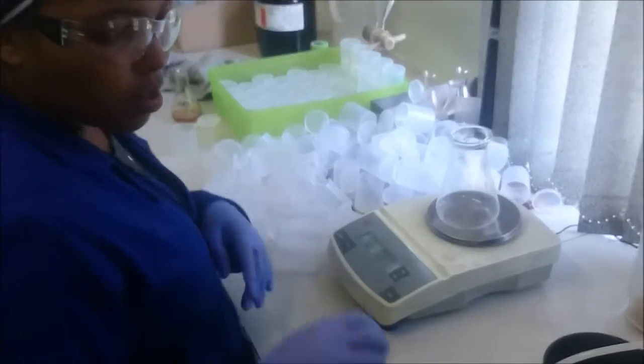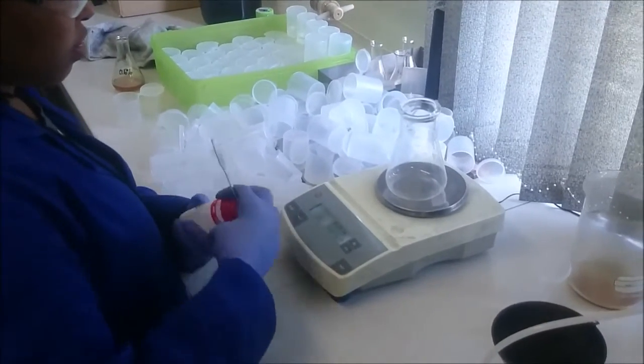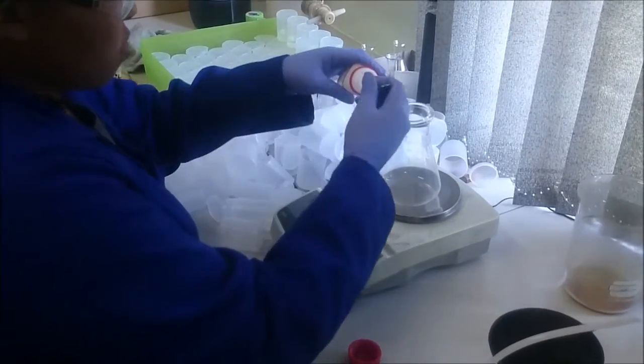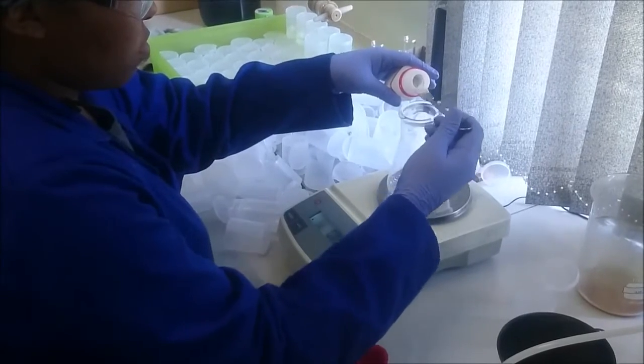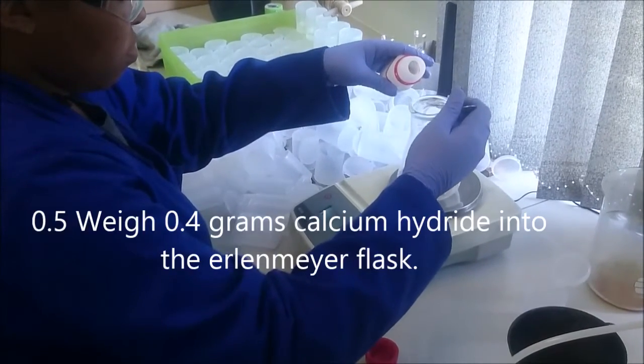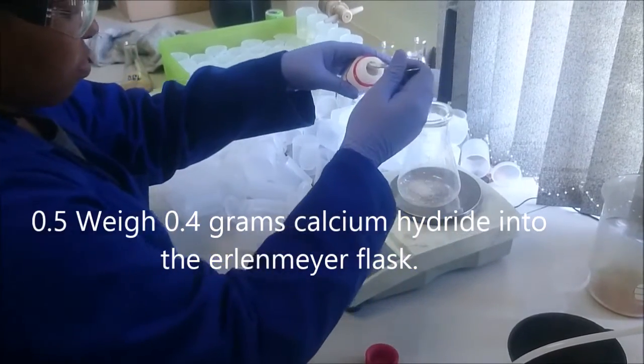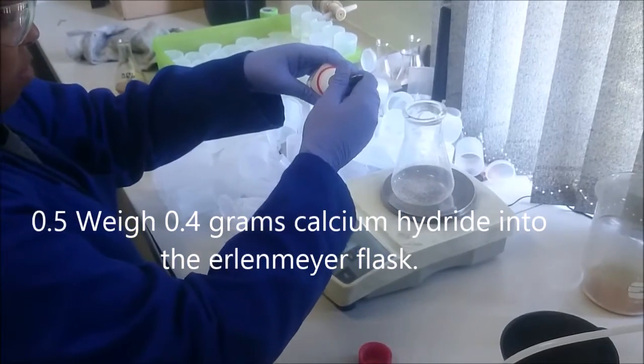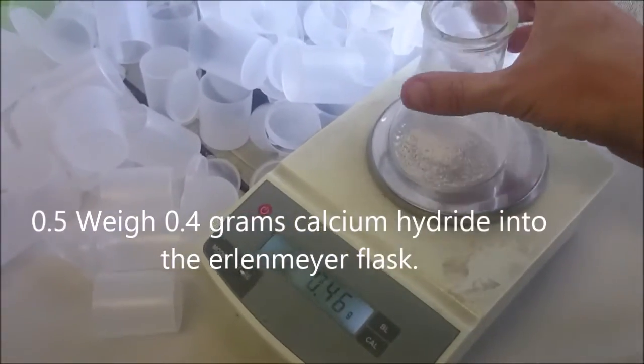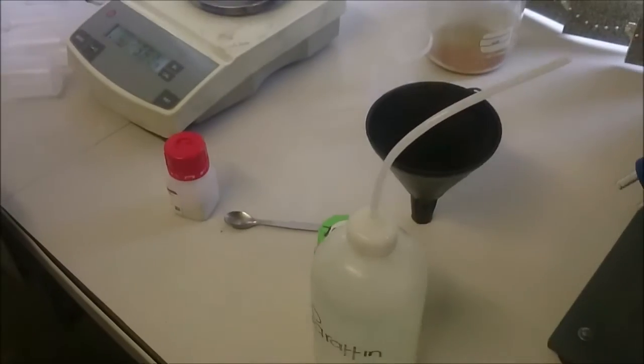Okay Brenda, so you're going to weigh 0.4 grams of calcium hydride into the flask. So we've weighed up 0.4. We're now going to mix.